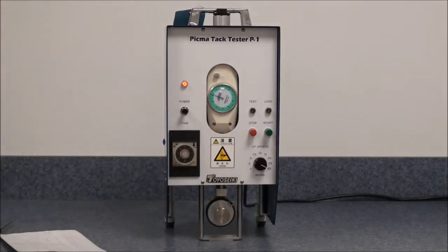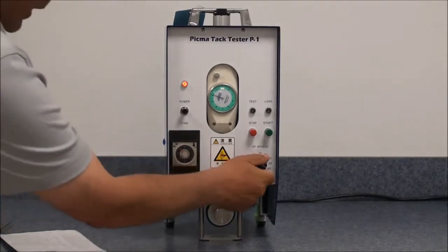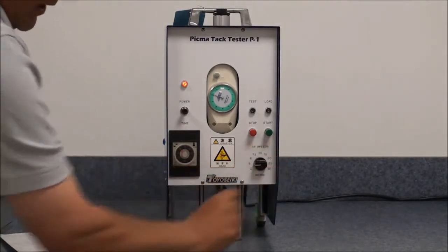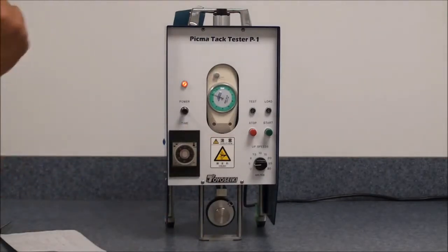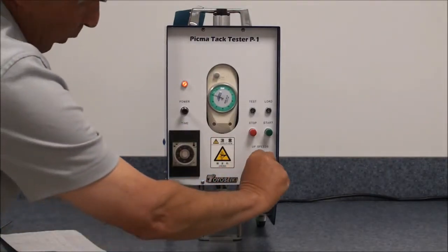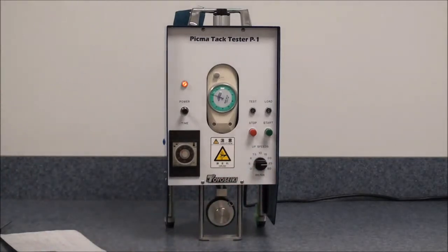To perform a test, what the customer must do is set the speed for the upward motion and we'll set it at 25 millimeters per minute, which is about one inch per minute.